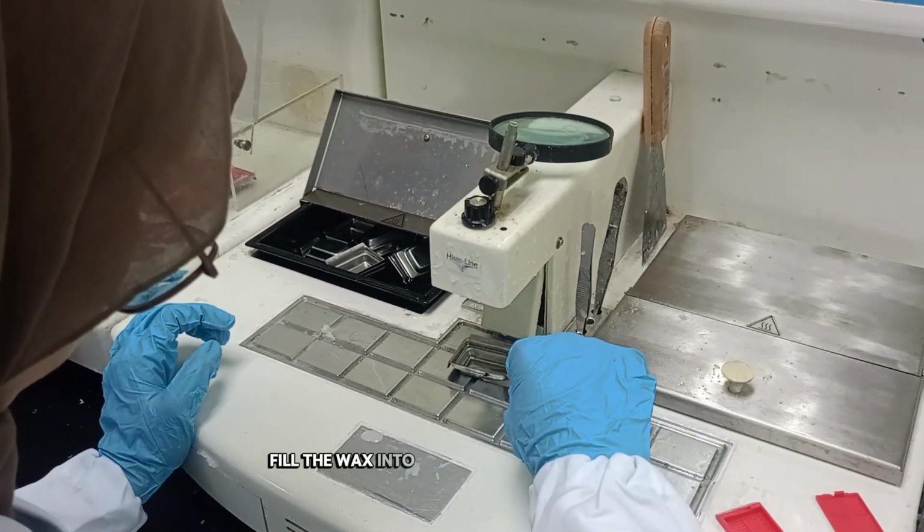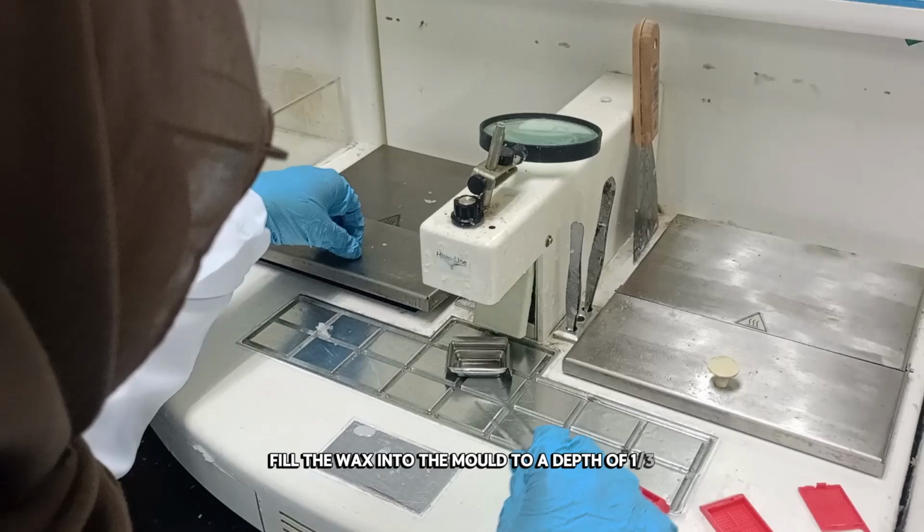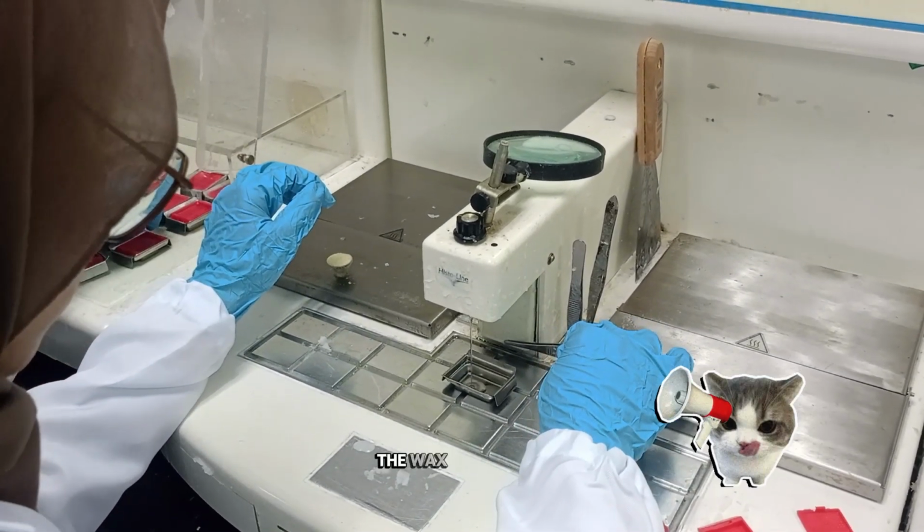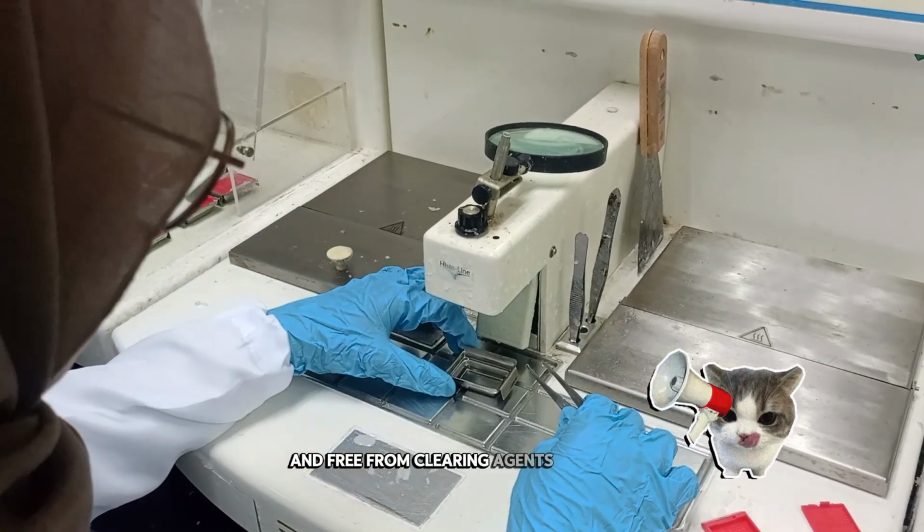Fill the wax into the mold to a depth of 1/3. Wait until it forms semi-solid. The wax must be clean and free from clearing agents and dust.